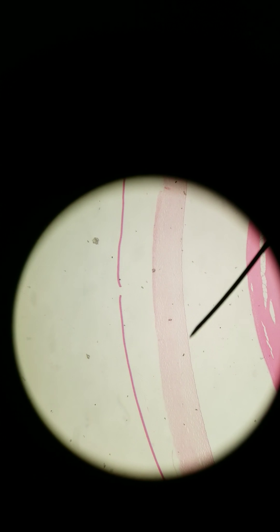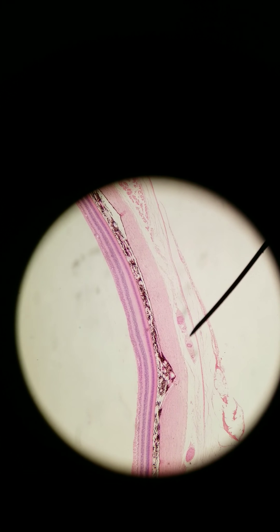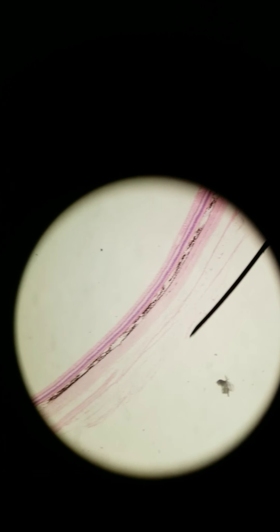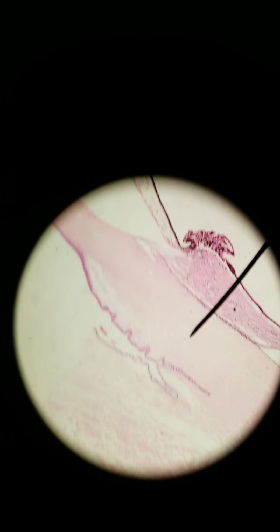So this is the anterior side, the front, and we go through all the way to the back. Here's the very back. And if I follow this all the way around, it forms a full circle. So I need you to envision that in your mind.